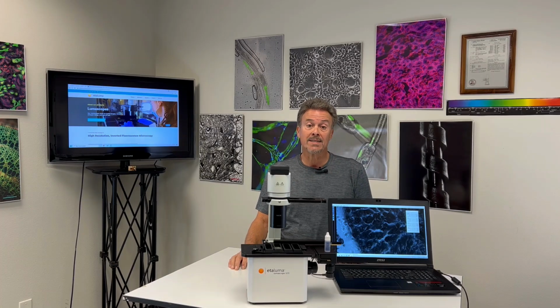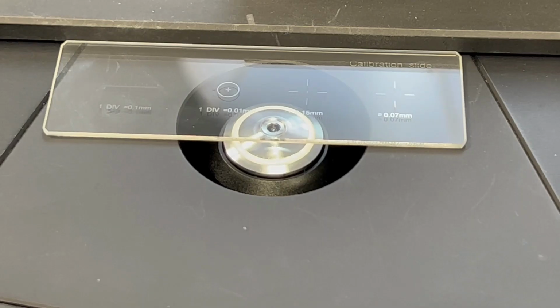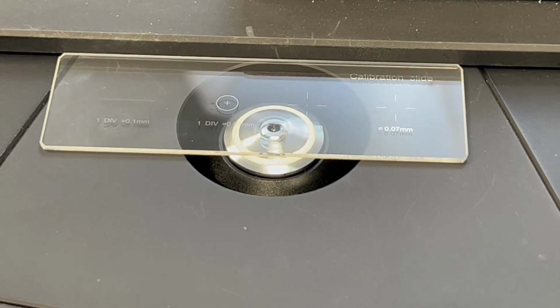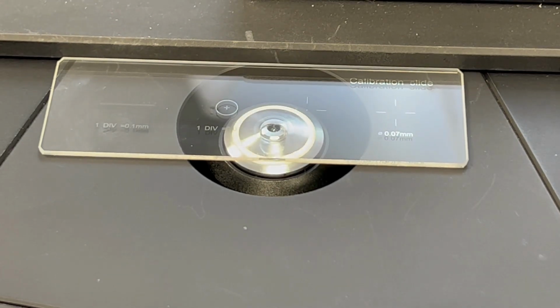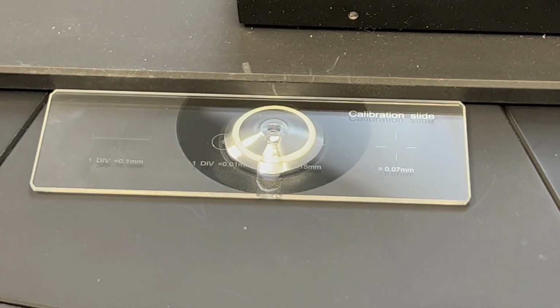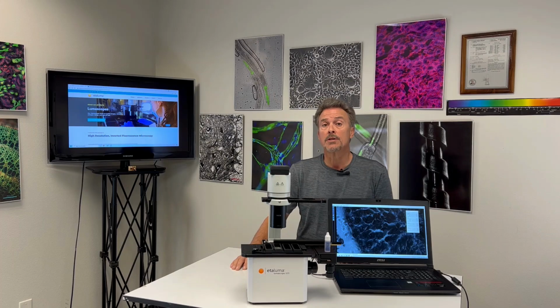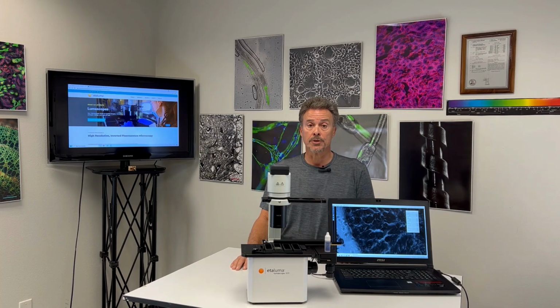Moving in X or Y tends to break the coupling if done too fast or too far. Without oil replenishment capability, we are limited to small areas using oil immersion objectives.